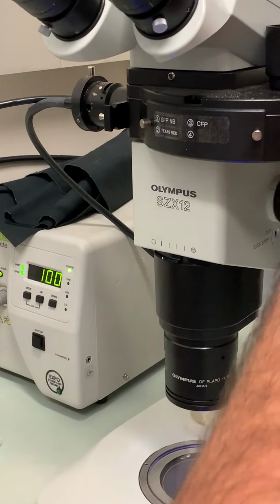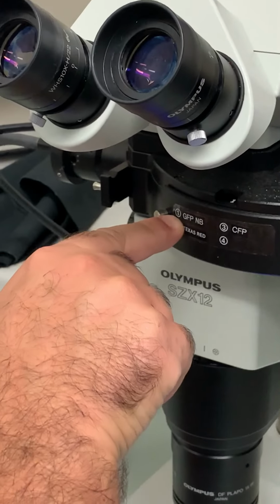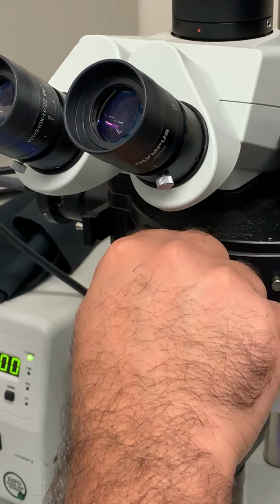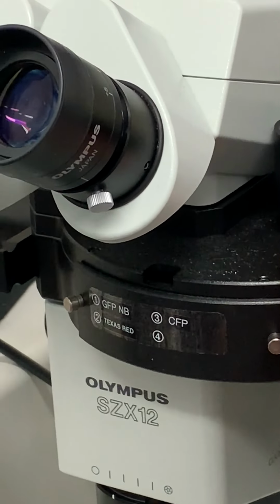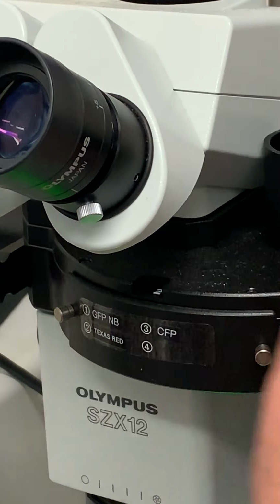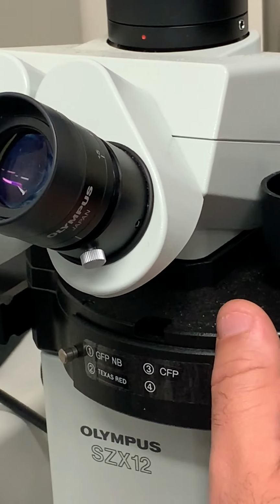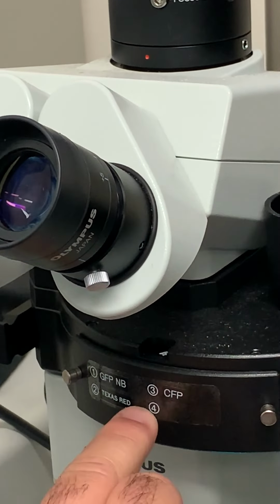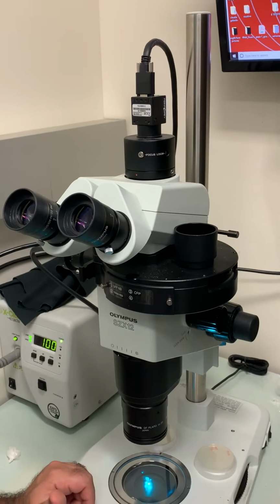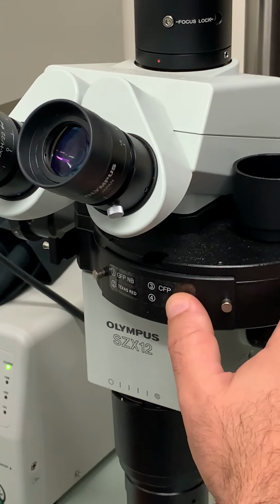And the last thing is the filters, and this is the wheel. You can see here it says the number 1 filter is for GFP, and you can see the number 1 up on the top here. When you move this wheel, you can move it to number 2, which is now for Texas red, and number 3 should be for cyan, although it doesn't look like it's there. Oh, actually it's number 4, so the cassette for cyan is in number 4. No big deal. So we're gonna move it to number 1 because that's where the green is.